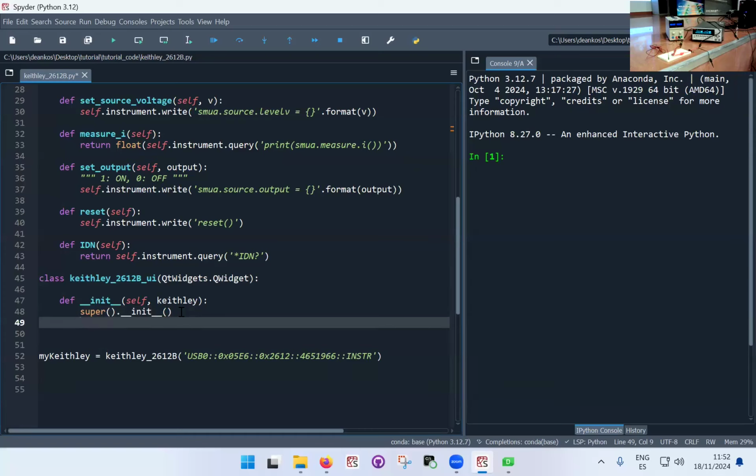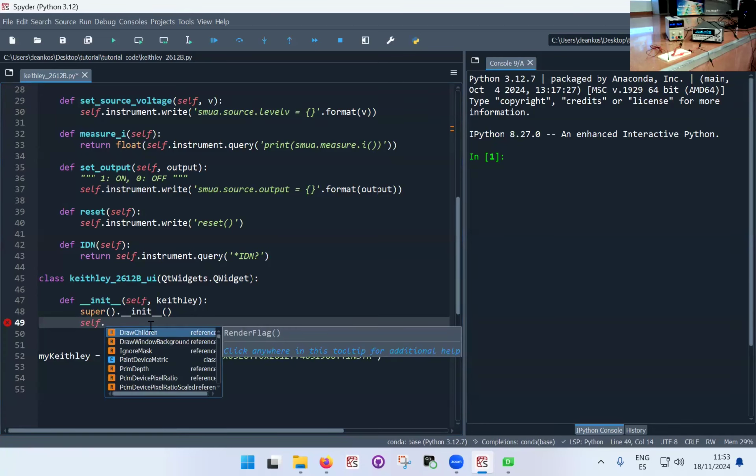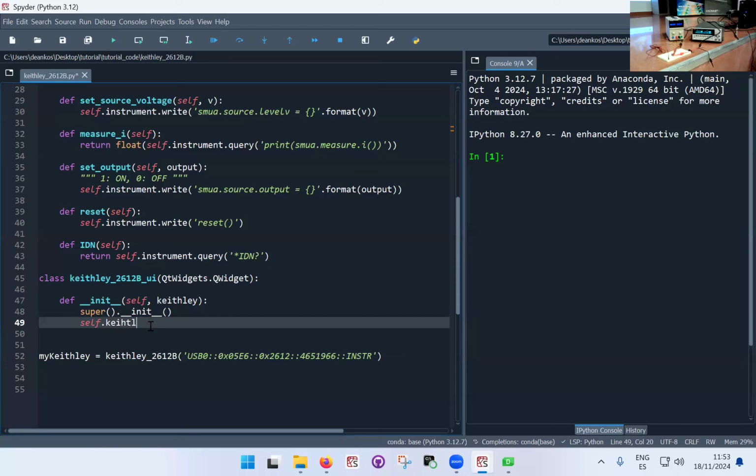And now I have to create within this. So when I call this class to generate an instance, an object of the Keithley user interface class, I'm going to pass the Keithley instrument, but this is momentarily stored as a local variable within this function. So I have to assign it to the class itself. So I'm going to go self.keithley equals Keithley. This means that the instrument that I pass as an object is being assigned to the class itself, and I will be able to refer to it with self.keithley in the rest of the code of this particular class.